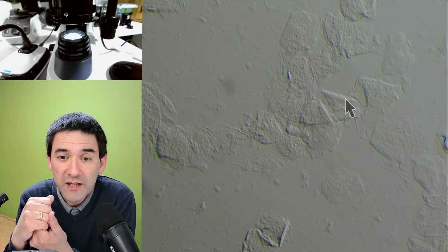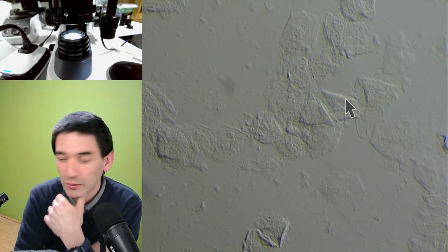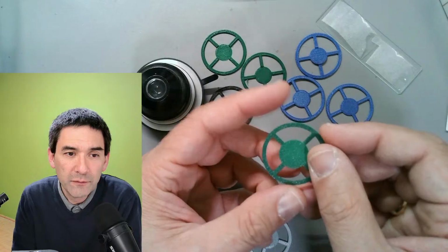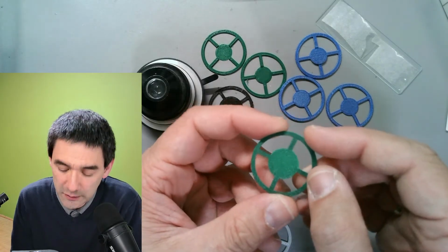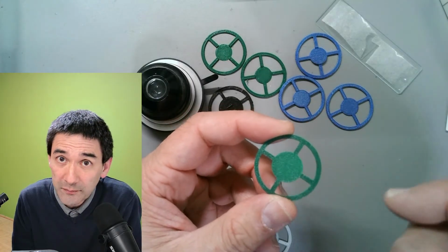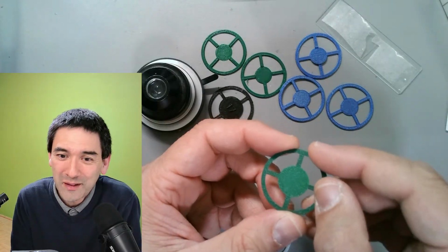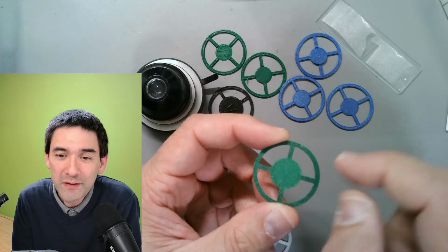Lots of the standard filters I see online don't fit, since it seems to be proprietary. The thing is the following. The filters not only have to fit into the filter holder, but the size of the central patch stop, if you want to use dark field or Rheinberg, also has to be the correct size. If you make it too small, then the background will not be completely dark. And if you make it too large, then the whole image will be too dark. The optimum diameter also depends on the magnification that you use.